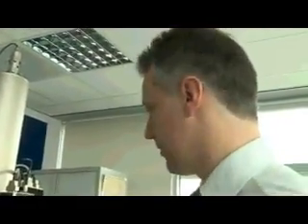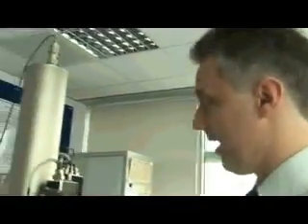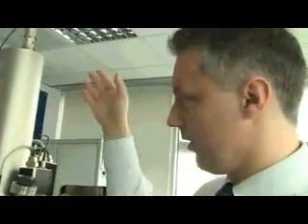Okay, so this whole instrument is actually called a secondary ion mass spectrometer, and it's designed to deliver a beam of ions towards the surface. That's some small particles. As those particles bang into the surface, they fragment off whatever is on our material, and those materials come out and they're put into a mass spectrometer, which basically separates it out and tells us what each one of those components is made of. The reason it's in this steel chamber is because we have to do this experiment under vacuum. So we've pulled all the air out. That's so those ions can travel to the surface and hit the surface.